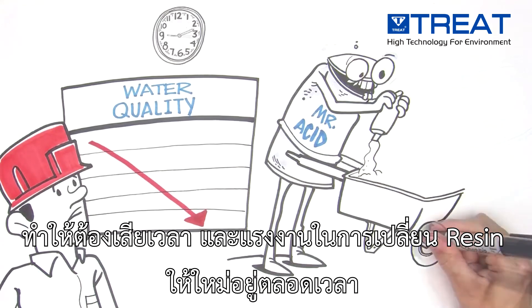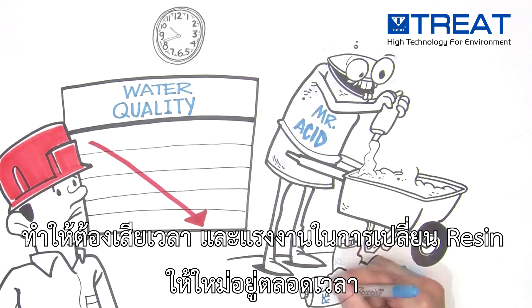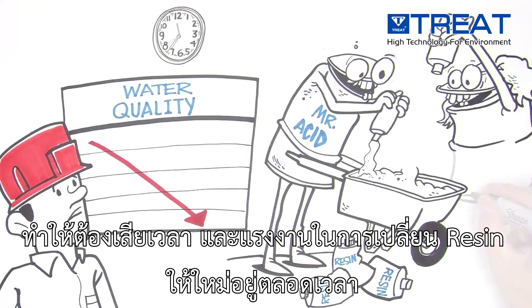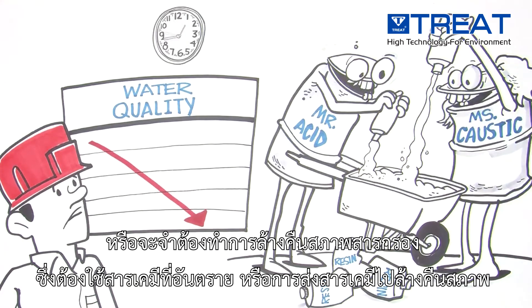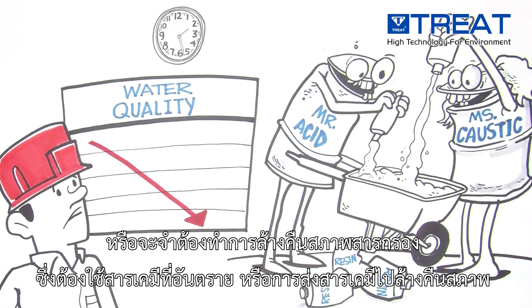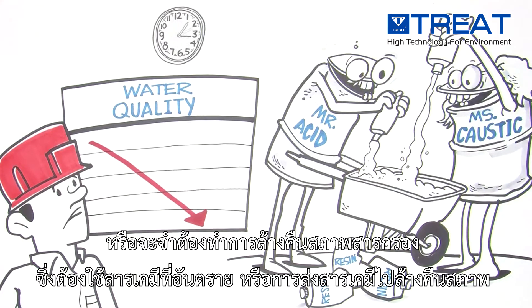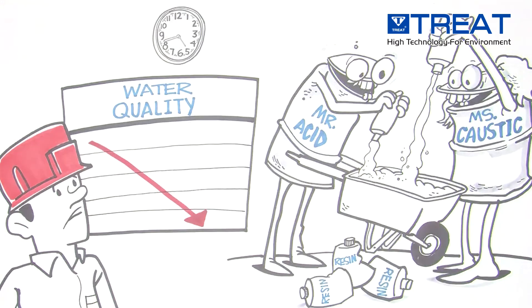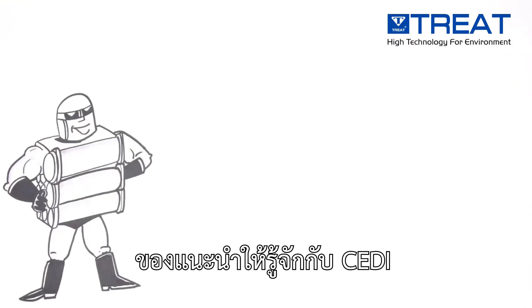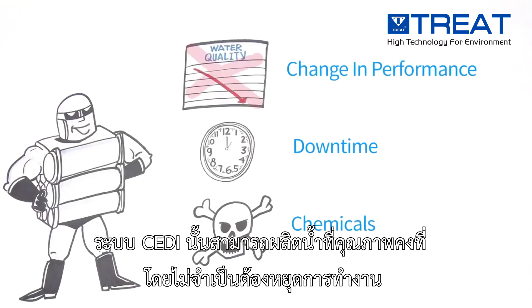Ion exchange requires downtime and laborers or service providers to exchange spent resin with fresh resin, or to regenerate the resin using hazardous chemicals on site or at a regeneration facility. Enter IonPure.